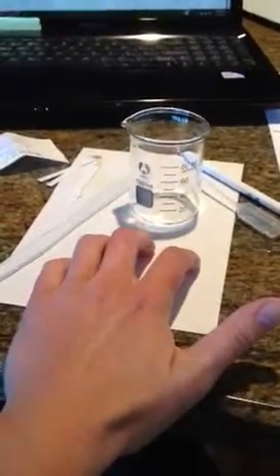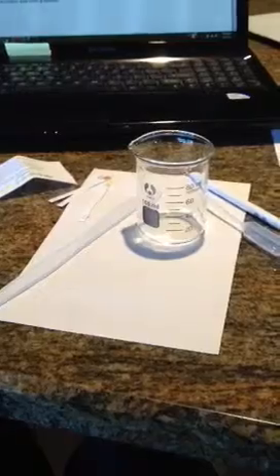But what we do is take our unknown, 2 milliliters of that, into our beaker, and then 1 drop of our phenolphthalein, which I think is just a color. That's what I think it's for. Anyway, it's clear to start, and then we just add our sodium hydroxide one by one with our dropper and keep stirring until it stays pink for about 30 seconds. And at that point we can take our pH using our high range pH paper and get our final pH for that solution.